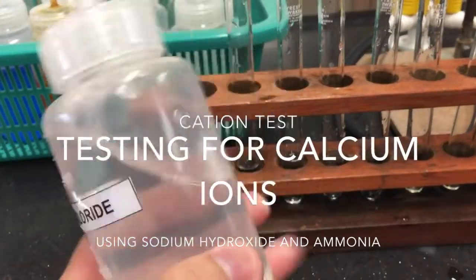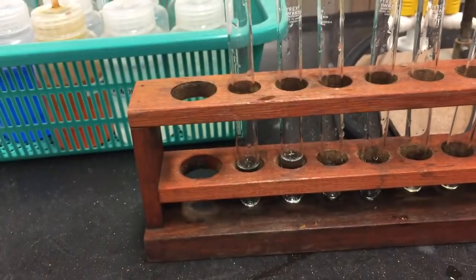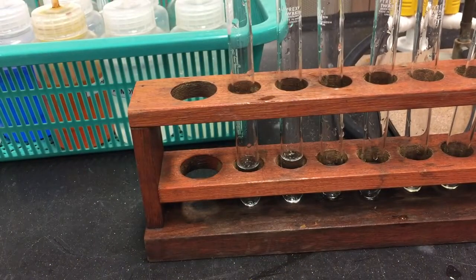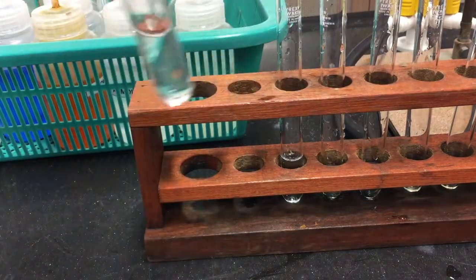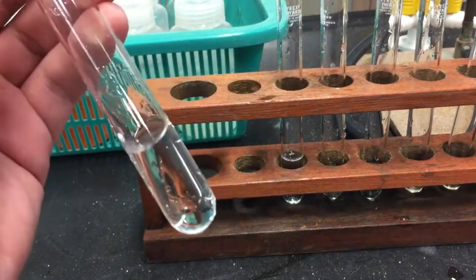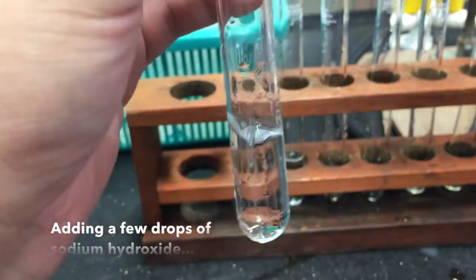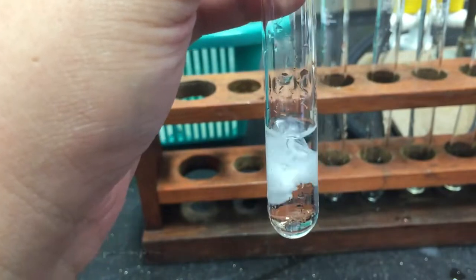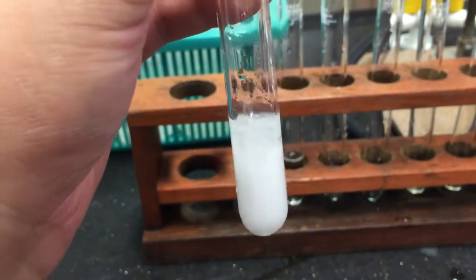Solutions containing calcium ions are usually colorless. To test for the presence of calcium ions, we may employ the sodium hydroxide test. To a small sample of your solution, add a few drops of sodium hydroxide. Immediately, a white precipitate forms.